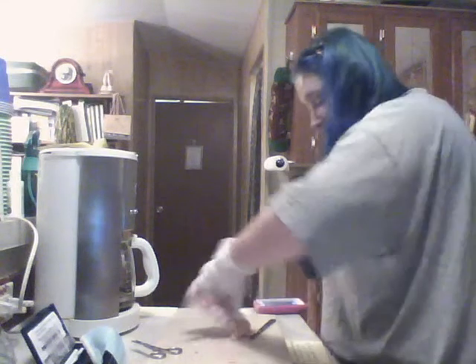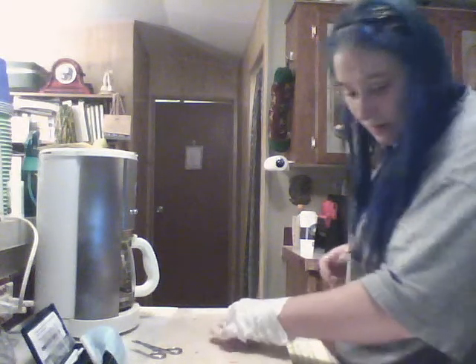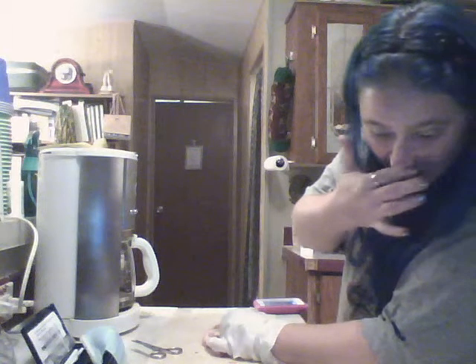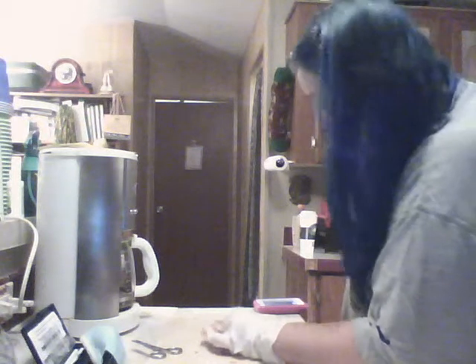So, the one that makes the elbow, the ulna.